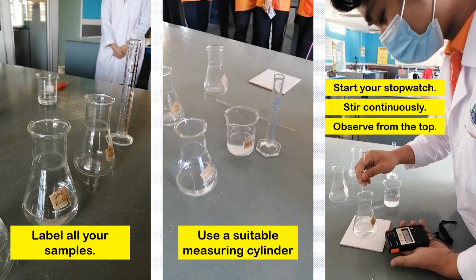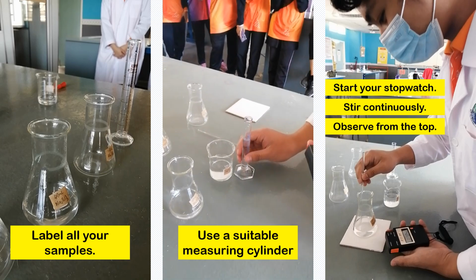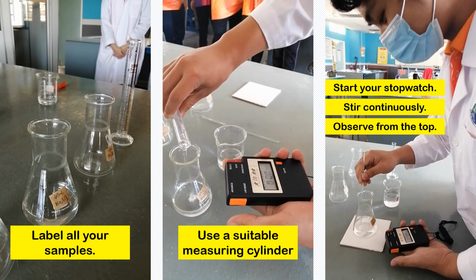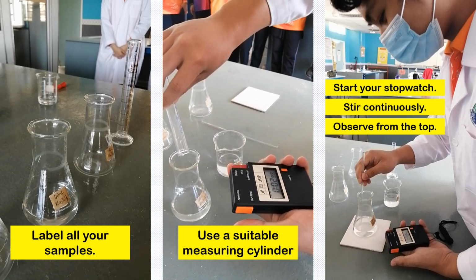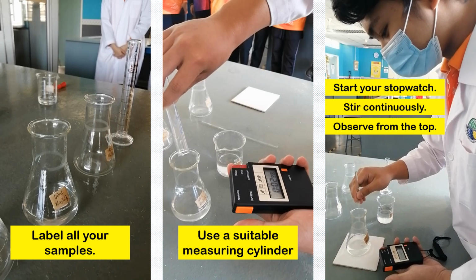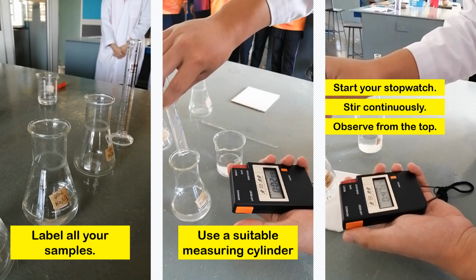Next, your diluted sodium thiosulfate is ready to be mixed with hydrochloric acid, and use a suitable measuring cylinder. And immediately start your stopwatch. Stir continuously and observe the change in the solution from the top.